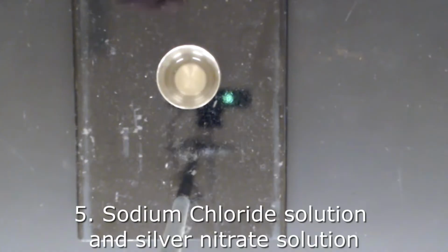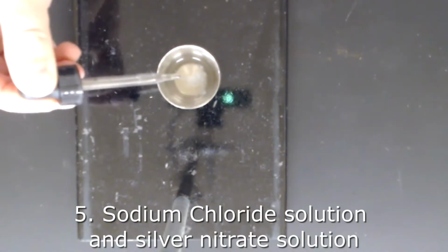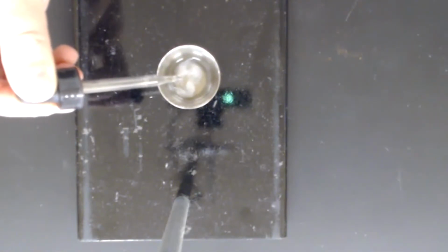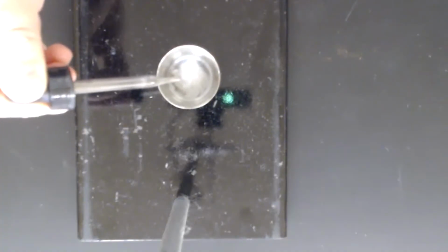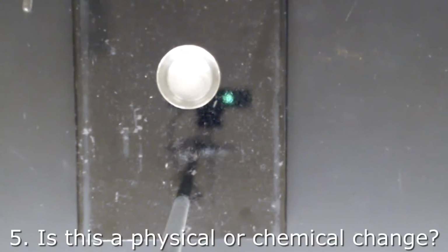In our next step, we are going to add a few drops of silver nitrate. Adding silver nitrate causes a white precipitate to form.